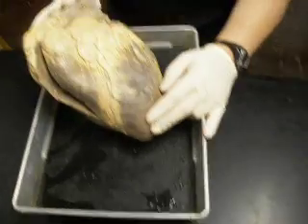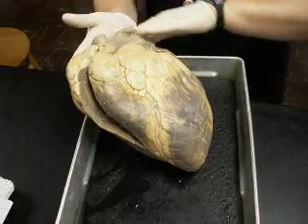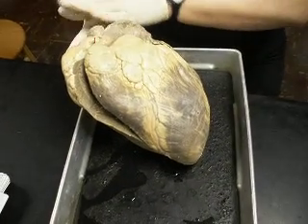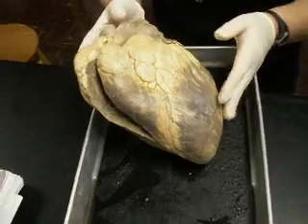But then people have also said it's just the top. Yeah, it's just right here. Okay. Maybe they're thinking that because most of the vessels are on the posterior side. Okay. Maybe that's why.